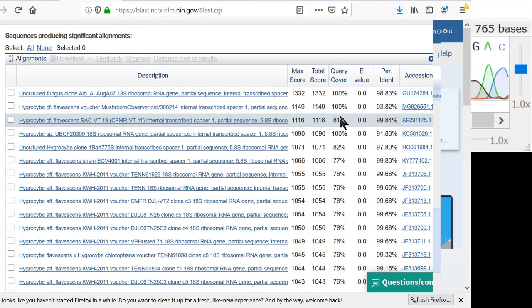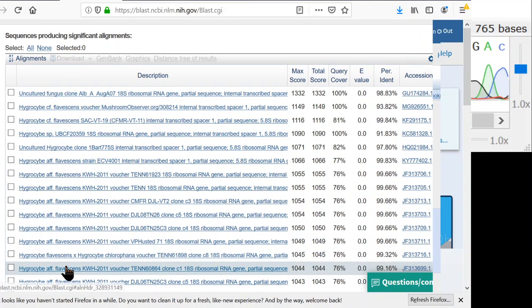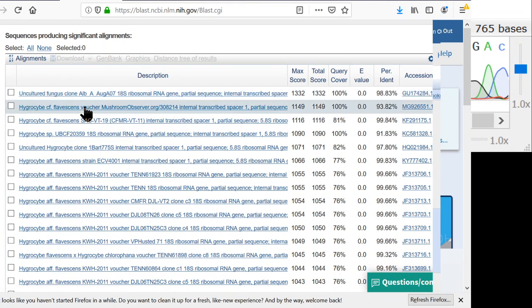And if you go down to here, you see this one is 81%. That means they used the ITS4 primer, so they don't have quite as much data, but still that's plenty. You can see that if we want to figure out what my mushroom is, Hygrocybe flavescens is what the BLAST matches are saying.